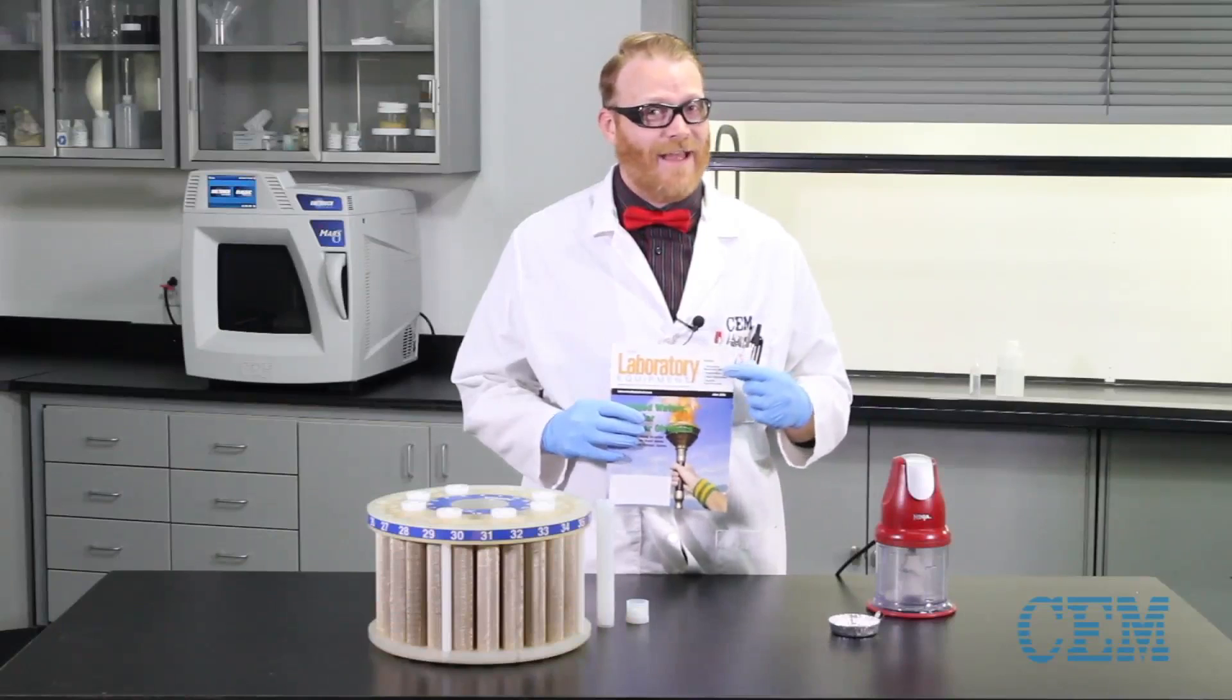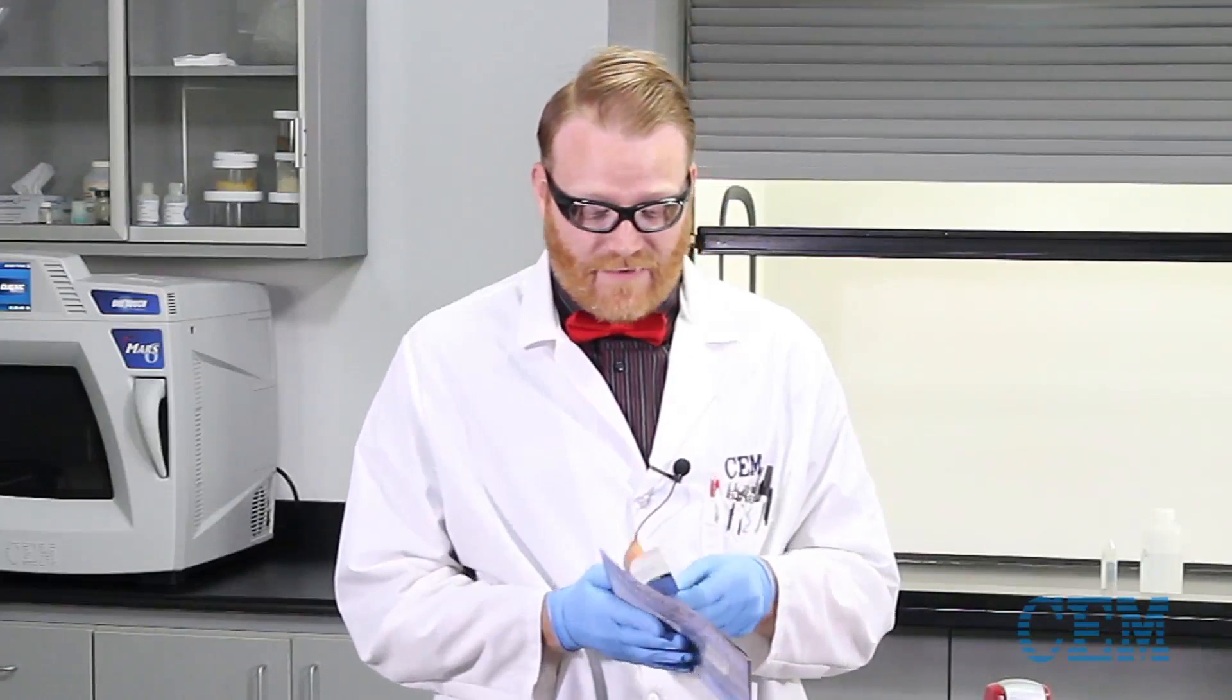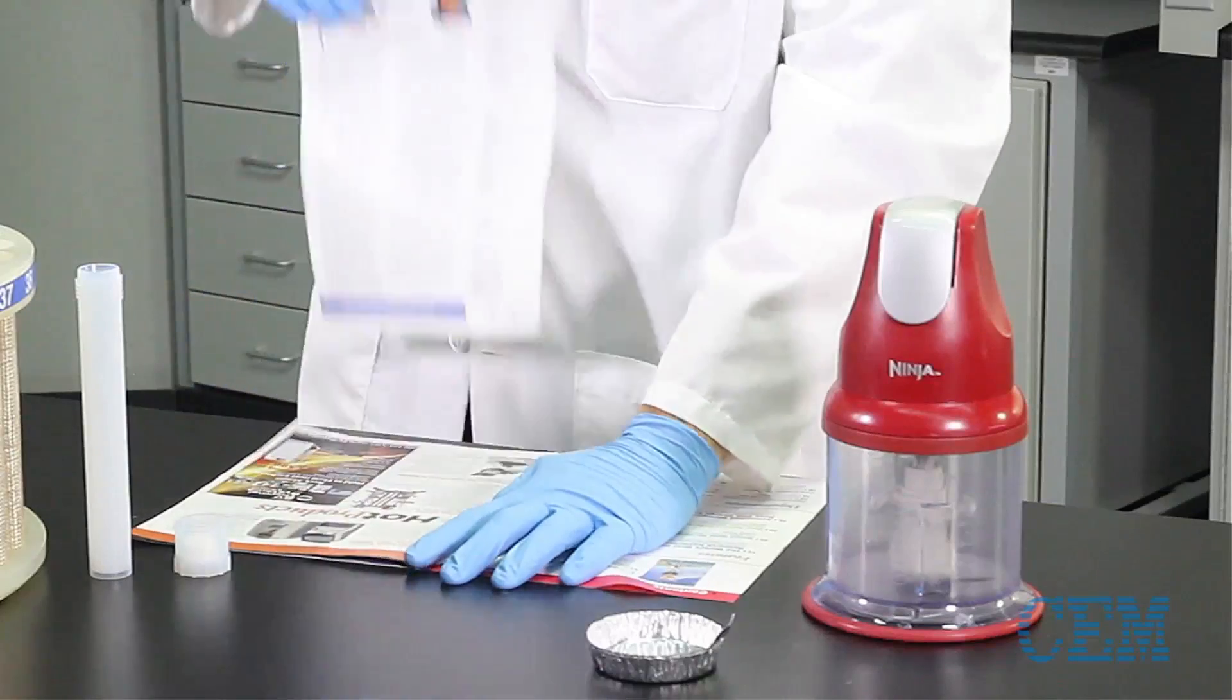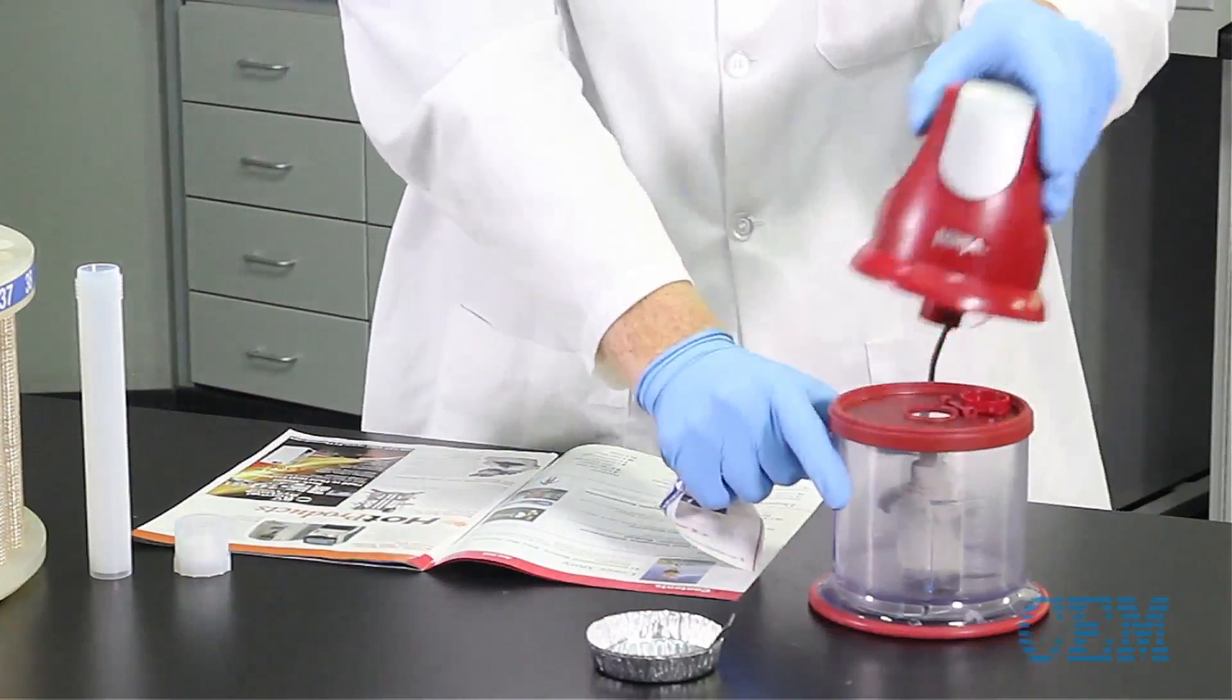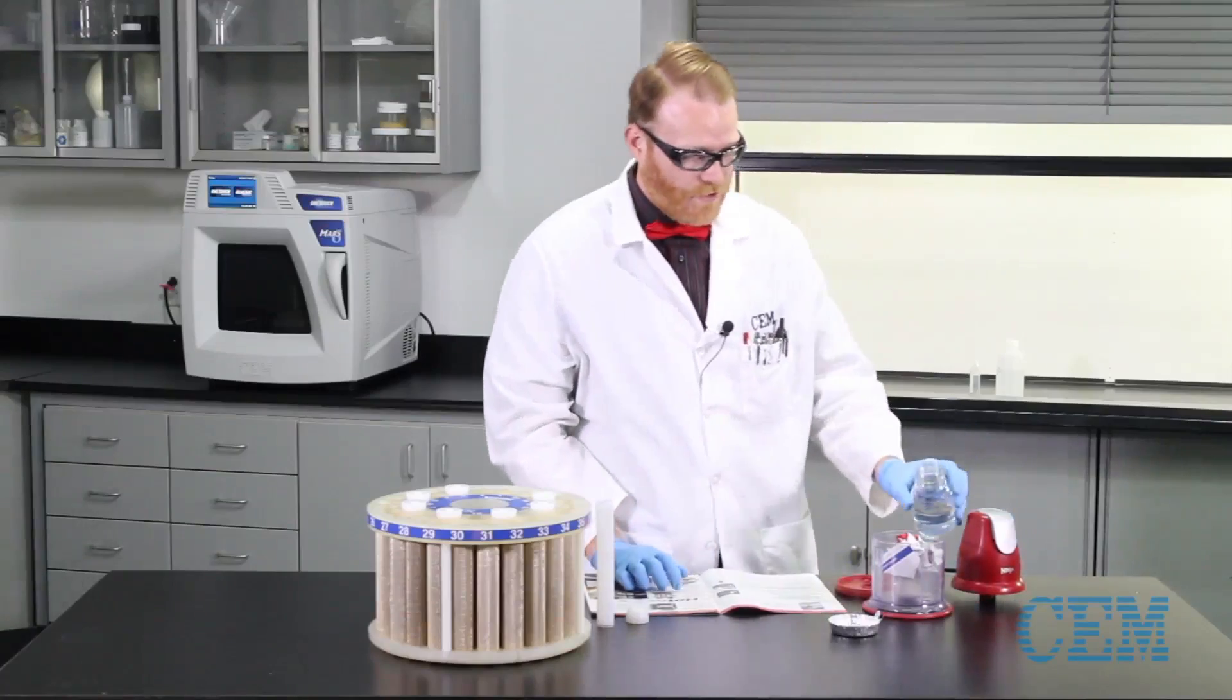I wonder who asked to get that digested. Well, normally what we would do is take this and grind it up, so I'm going to tear out a page and put it in our grinder. Gonna add a little bit of water for moisture.